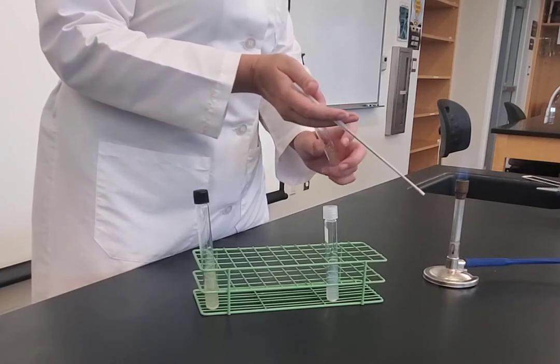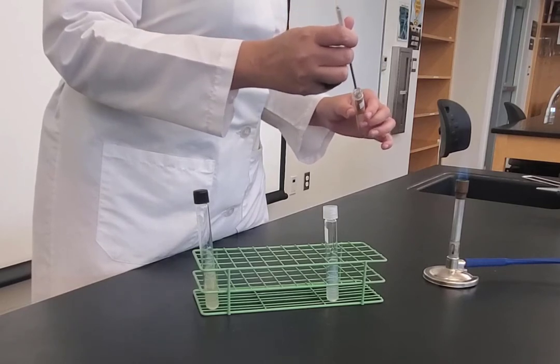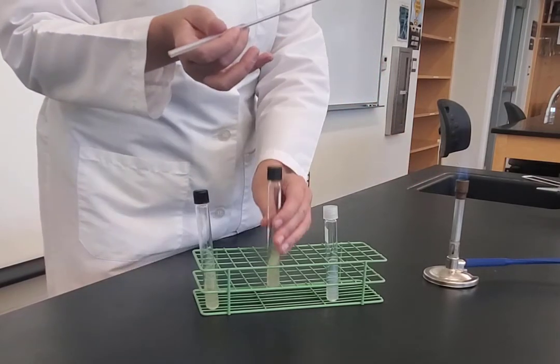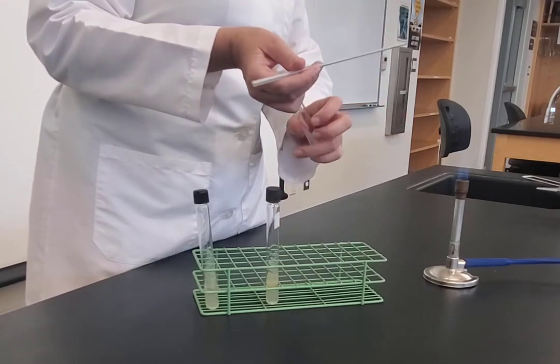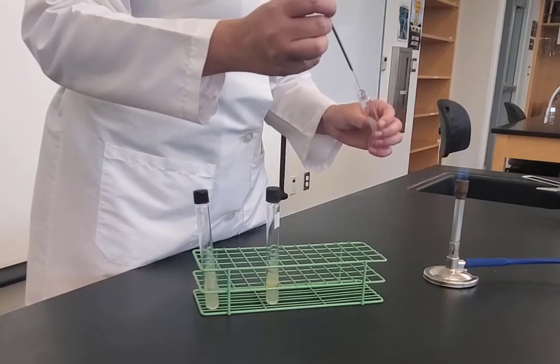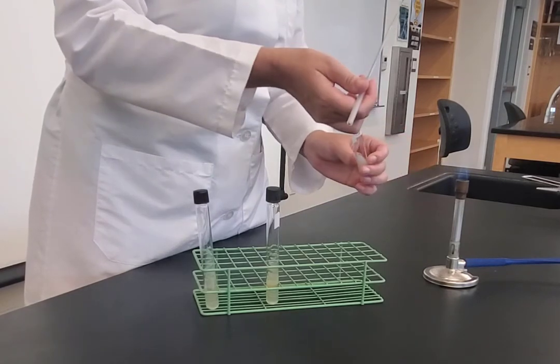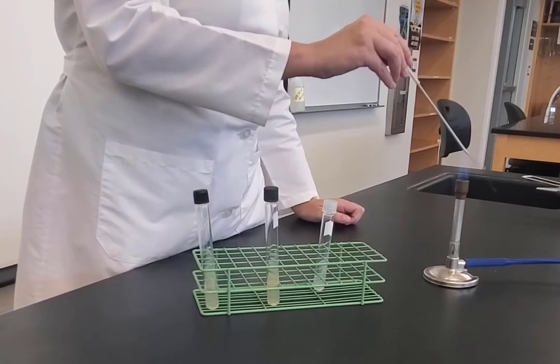Now I'm going to pick up bacteria from the slant and transfer it to the phenylalanine slant. I take the cap off, flame, and go in to pick up some of the bacteria — I don't need a lot. Then I inoculate my phenylalanine slant: take the cap off, flame it, and do my zigzag inoculation starting at the base, zigzagging up. Flame and cap, then flame the loop before setting it down.